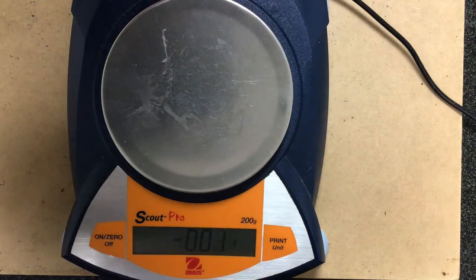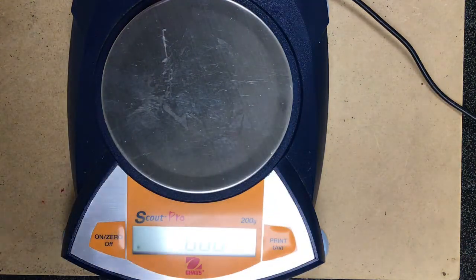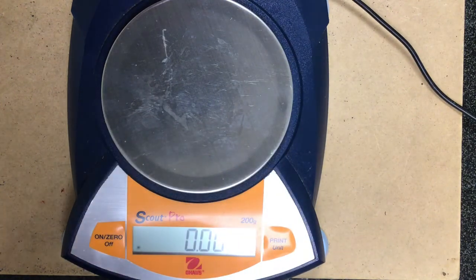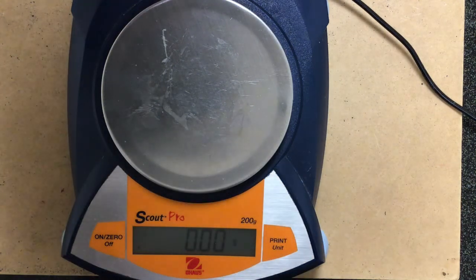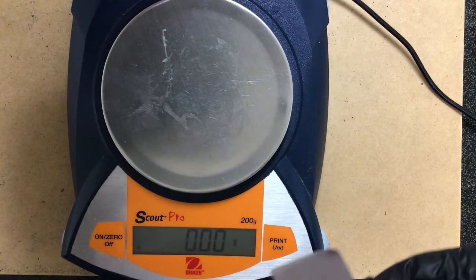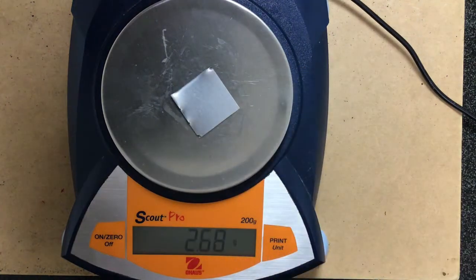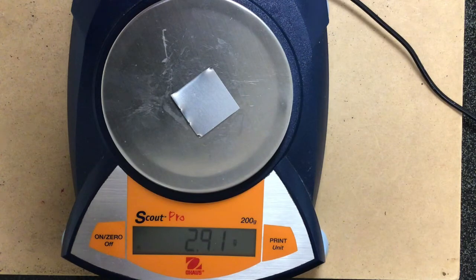All right, the last piece of data that you guys need in order to do the calculations is just the final masses. One of the things I tried to do is make sure that every single one of these pieces was rinsed off and then dried so that the only thing you would be getting is the dried mass, not anything where the water was influencing the outcome. So this is trial 1.